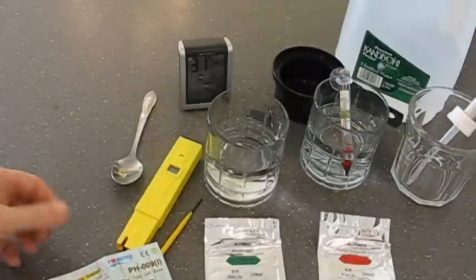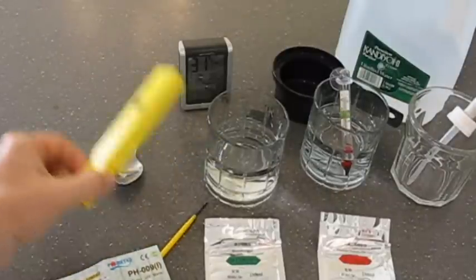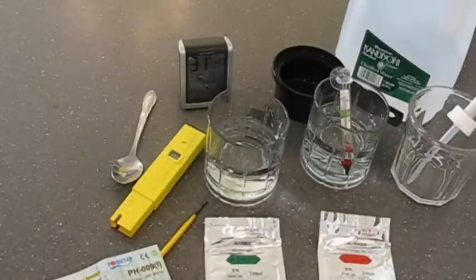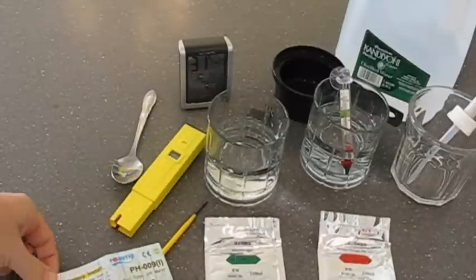I'm going to show you how to calibrate these inexpensive pH probes that I'm going to use to calibrate the water in my hydroponic system.